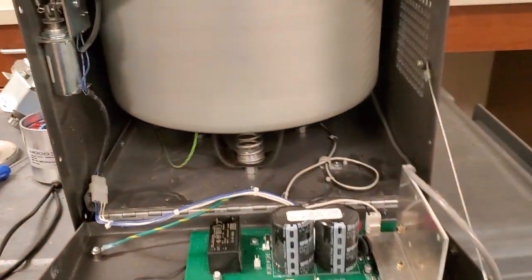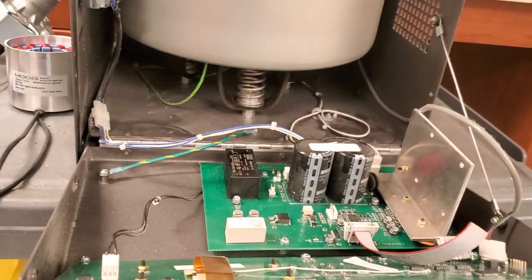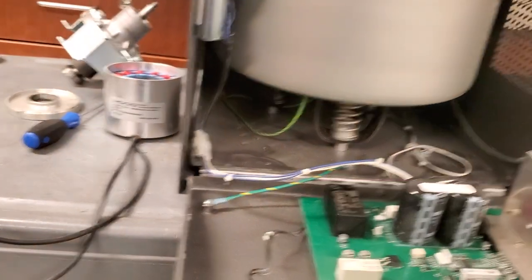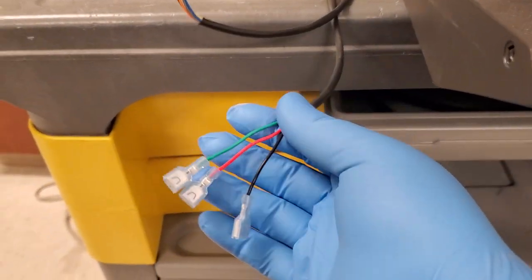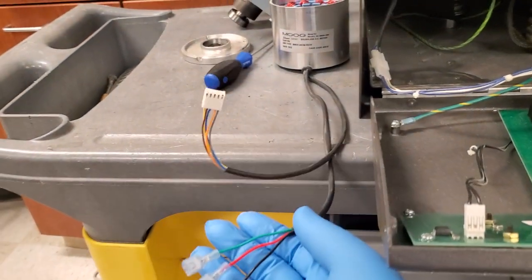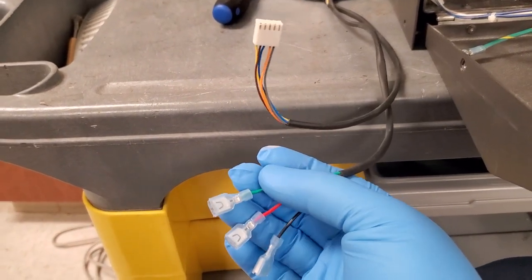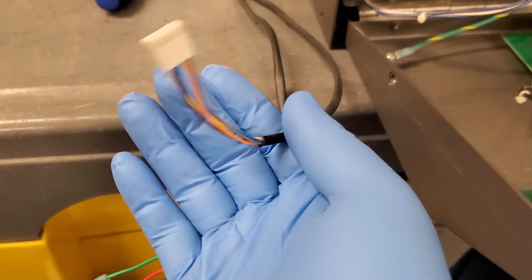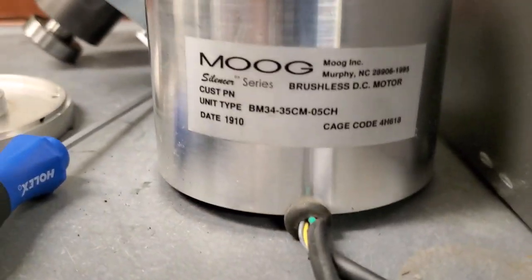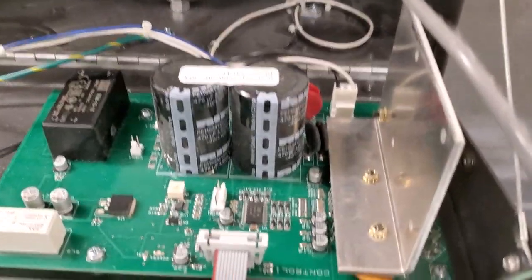Well, when I got in, a lot of the biomeds, including senior biomeds, thought that this one here had smoked brushes, bad brushes, which was causing the smell, and that was also causing the irregular noise. But when I got in and I saw this terminal configuration on a motor, you should automatically know what type of motor that is. One, two, three phase. So it's a three-phase DC motor. And this one right here is your encoder or your Hall effect sensors. So that's your speed feedback. And just to show it, there it is, brushless DC motor. No brushes. So that pretty much throws everybody's theory out the window.